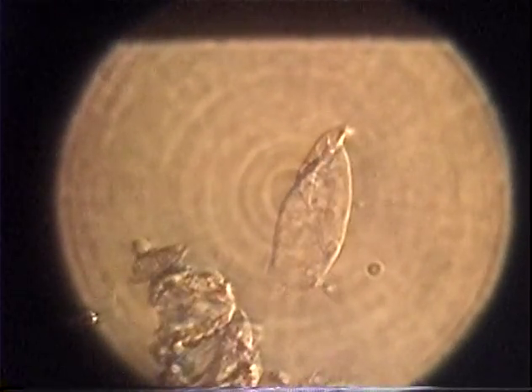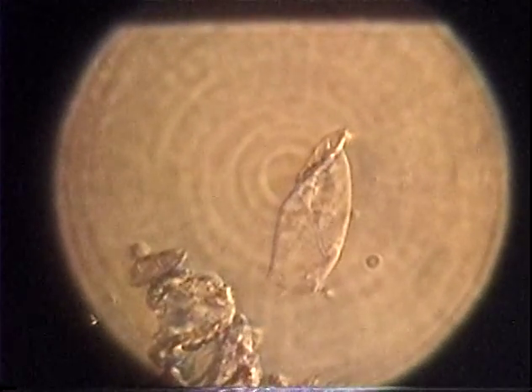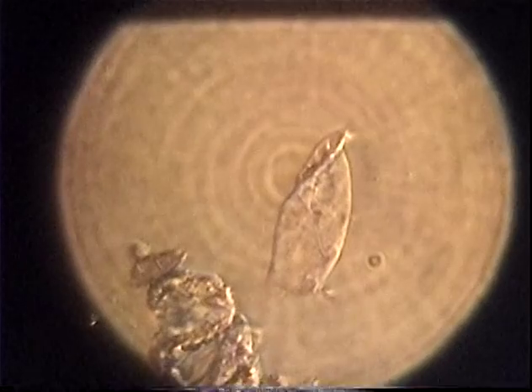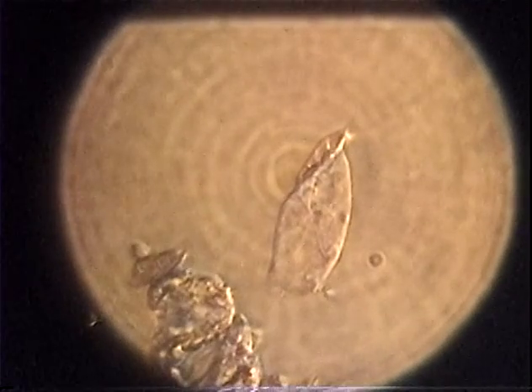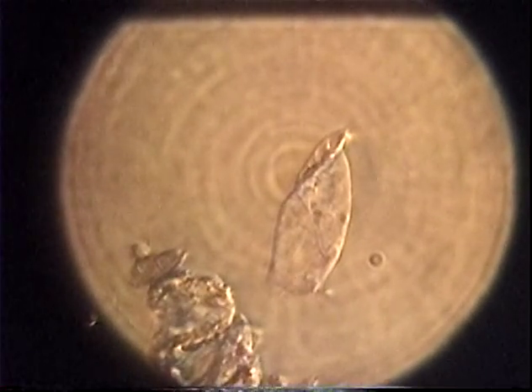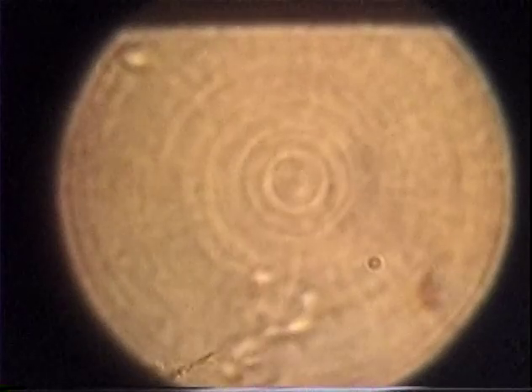All right, what do we got here? It's a pretty big thing. I think we got an amoeboid organism that's died. Oh, weird. It looks like a rocket ship. It's not complete. Yeah, the back half of it's gone. It does look like that. Well, let's keep looking around. What do you think was eating on it? I think it got squished in the transfer to put the sample on here. It's pretty rough. Having it smashed right between there, between slabs of glass.